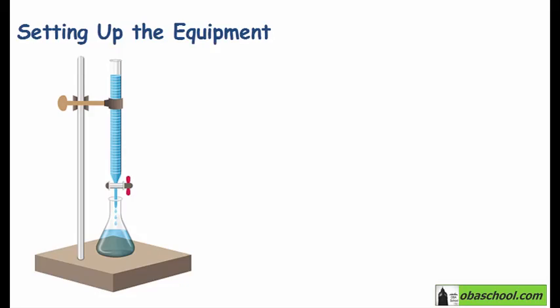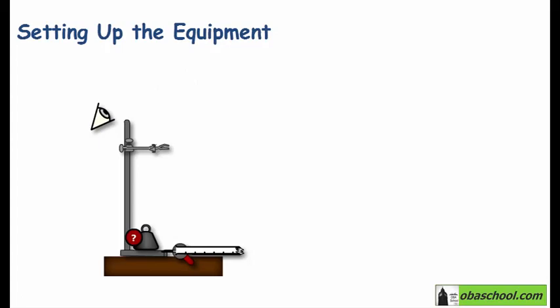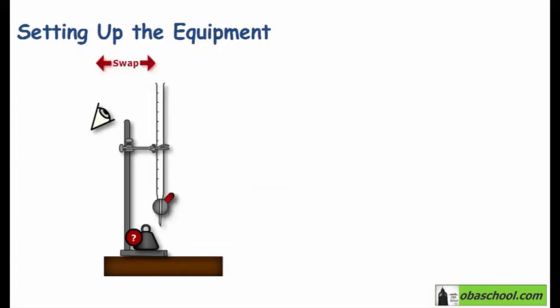An inexperienced scientist has set up a burette ready for filling. Let's fill this burette and see what happens. So obviously, this is not the right way to go about it. We will make some changes to the setup and fill the burette again.